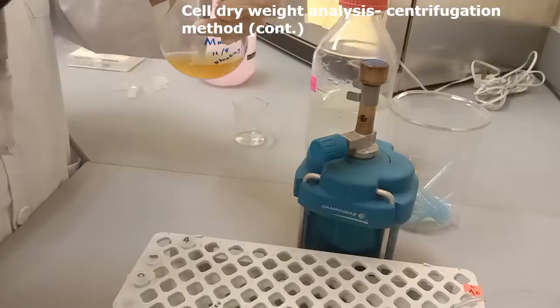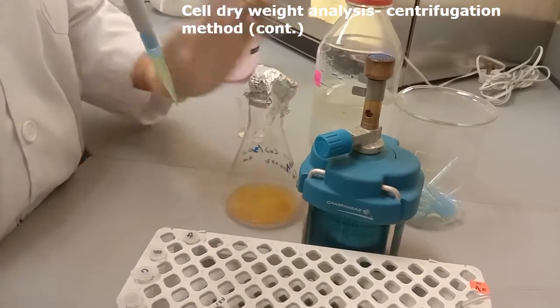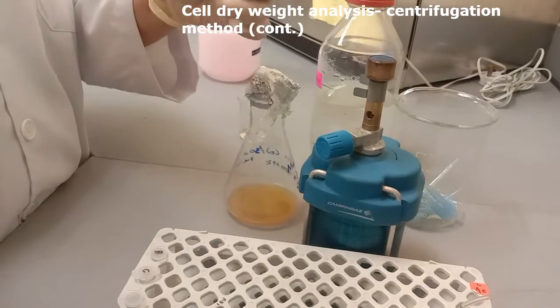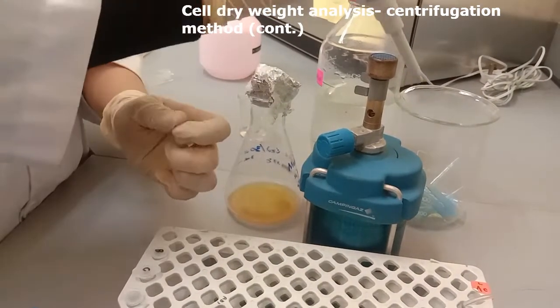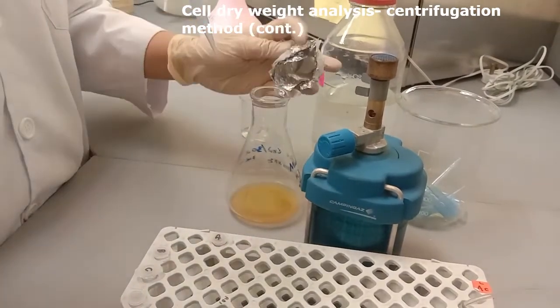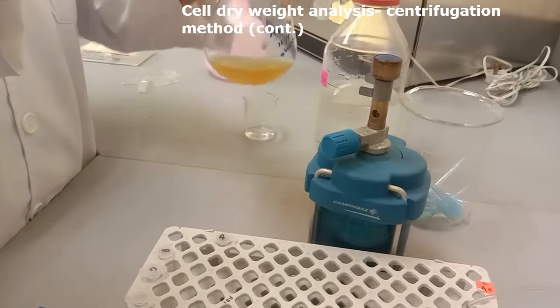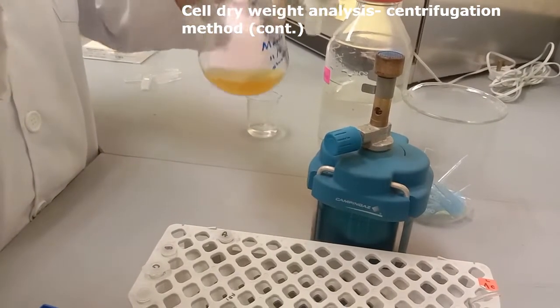To continue with the centrifugation method, transfer 1 milliliter of sample into a microcentrifuge tube. We recommend everyone to prepare your samples in triplicate.